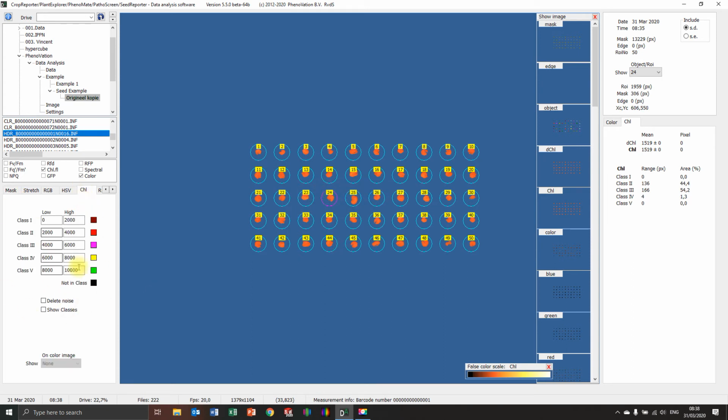In this case, I would also use some ranges. So we want to see the fluorescence of the seeds. So I would use a range. Well, the range was from around 1700, maybe there's 2000 in it. So I would say I'd start at 2000, and make some classes, like with steps of 200. So 1600 till 1400.